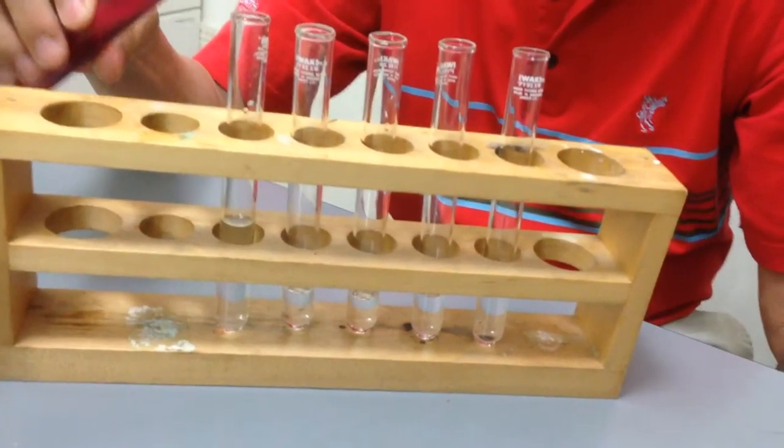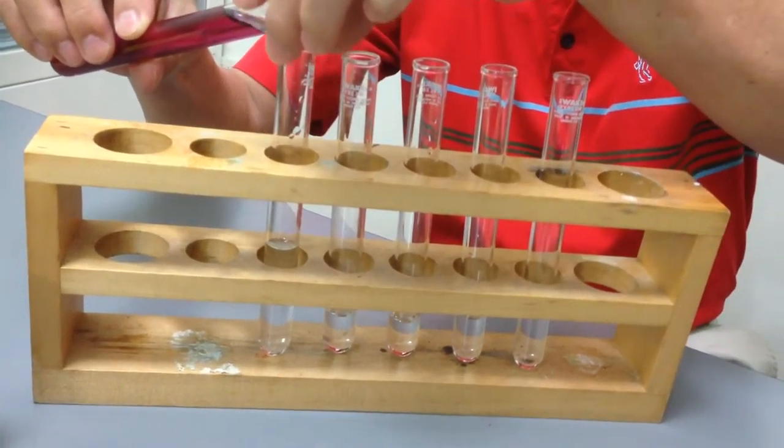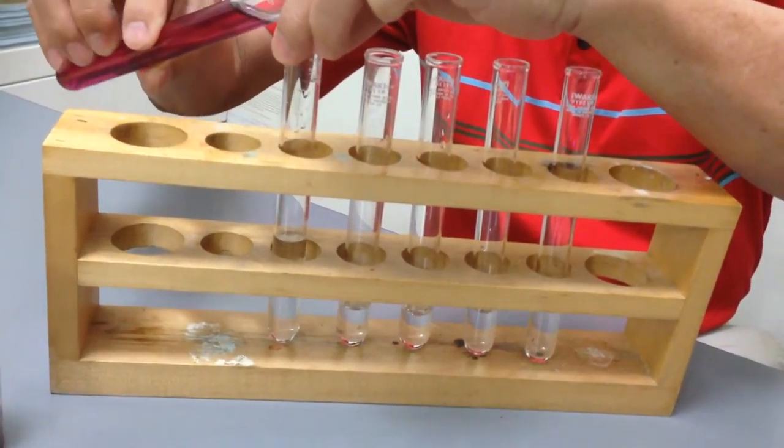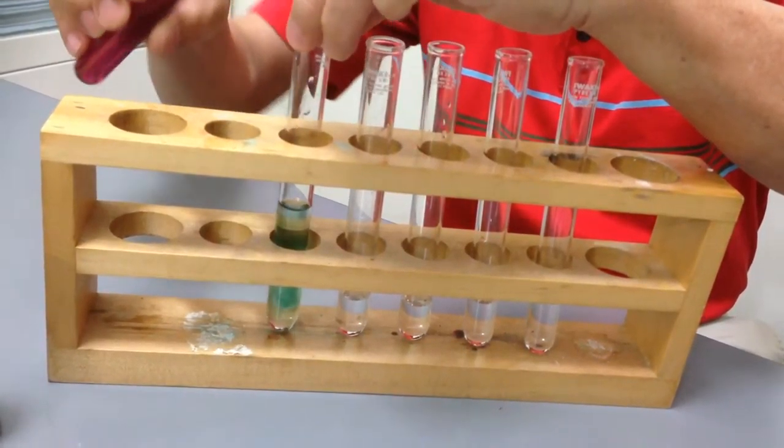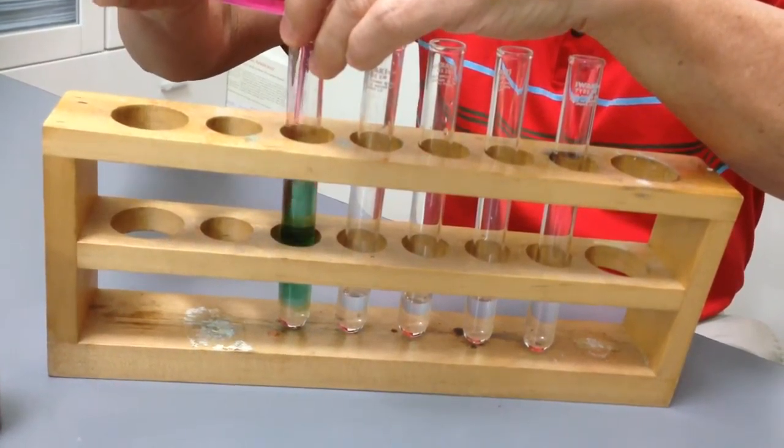So I am going to add it into sodium carbonate solution first. And you'll find that the pink color will turn green. The pink color will turn green. It will turn green.